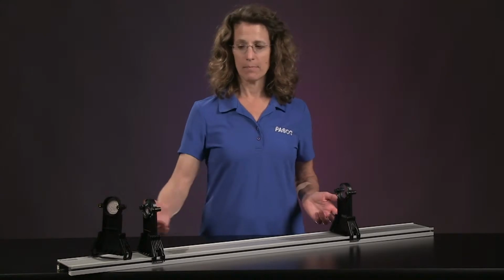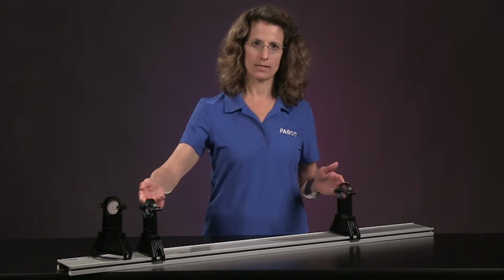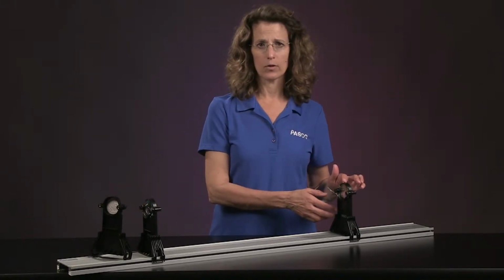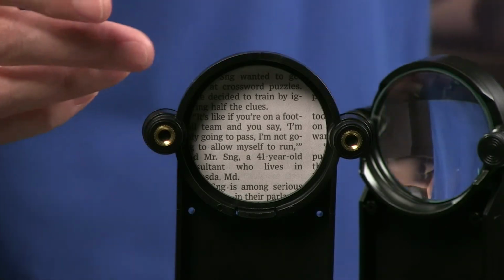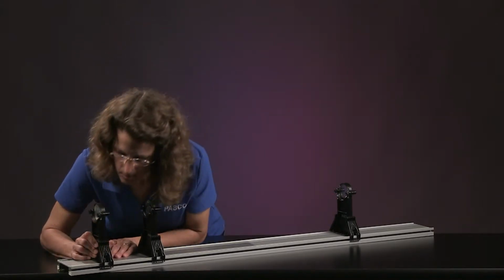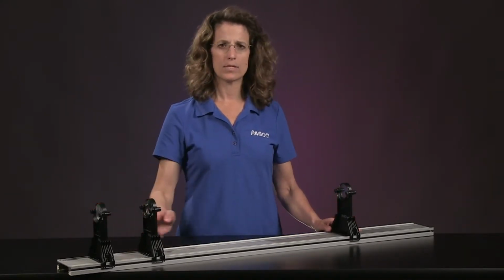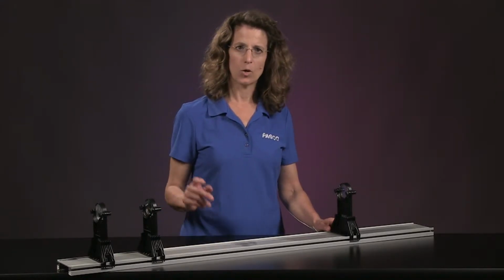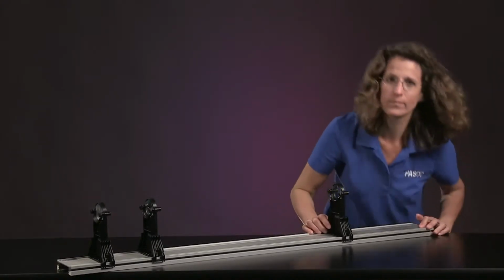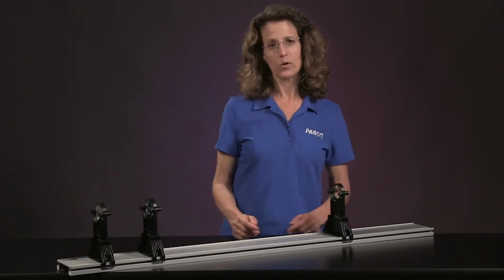Once you have determined the lenses that magnify the object, you can construct a microscope on the track using 3 lens mounts and 2 lenses. We will use the 10 centimeter focal length lens as the objective lens, the 50 centimeter focal length lens as the eyepiece, and a piece of written text mounted as our object. Set up the lens mounts using the distances that you measured and adjust the positions on the track to increase the magnification while keeping a clear image. You can read the object distance and the lens separation from the track and record it on the student sheet.